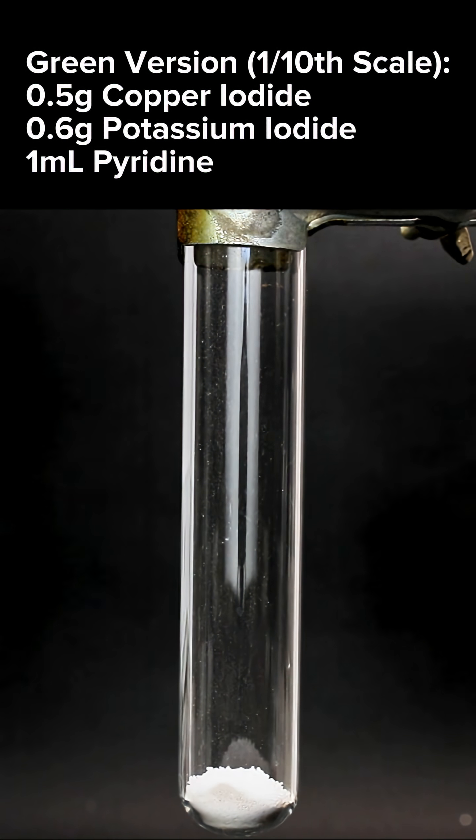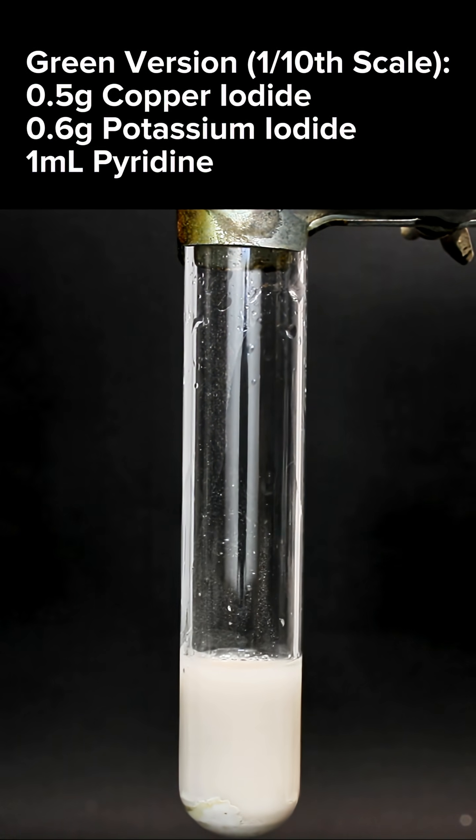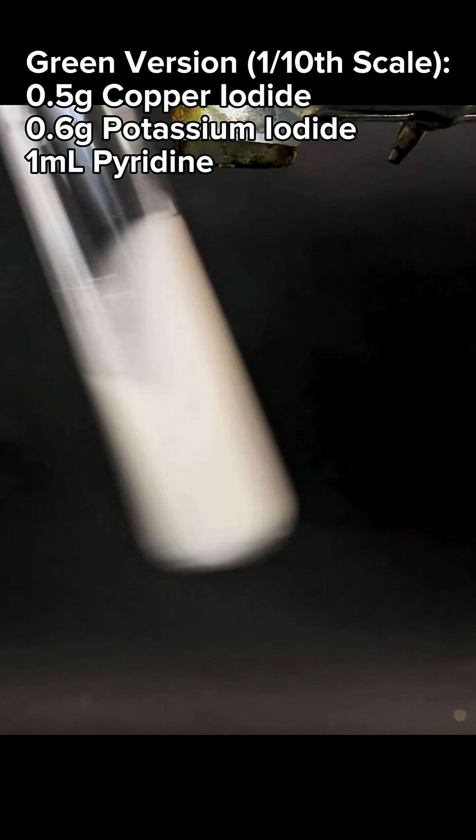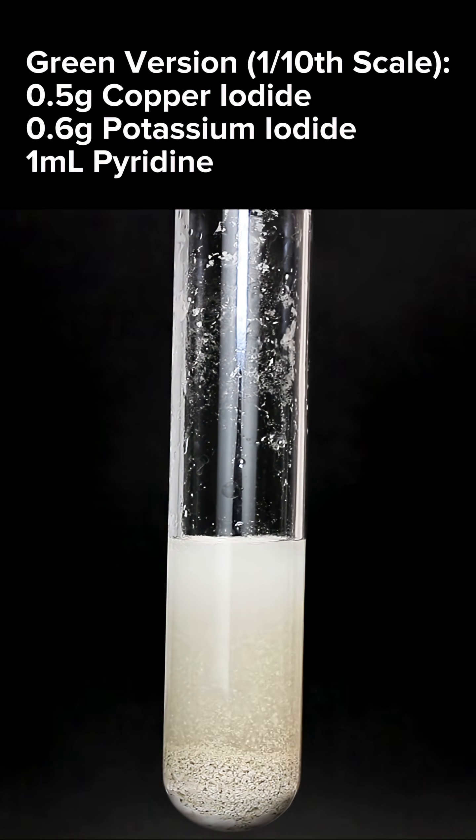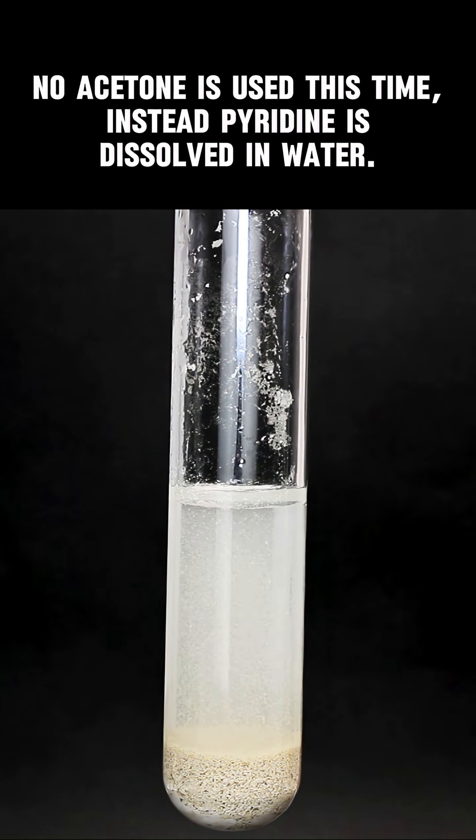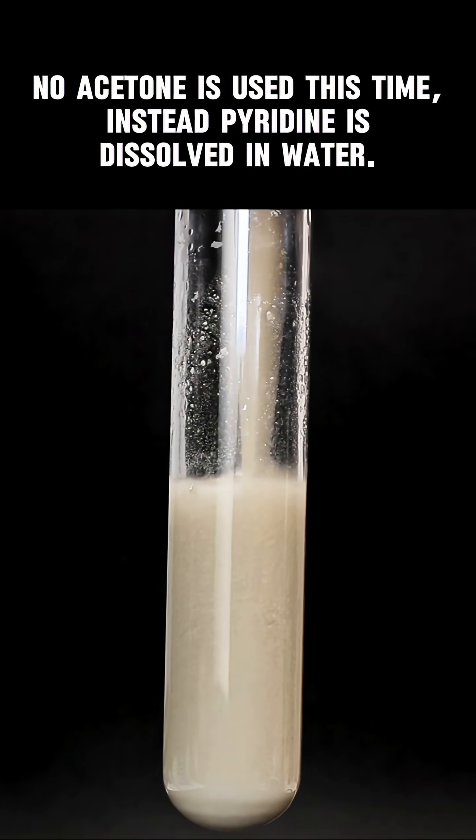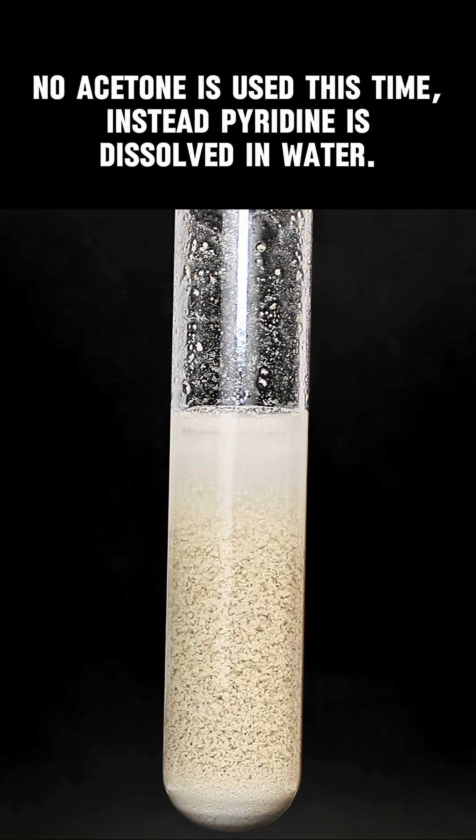However, you'll notice that this time pyridine is in massive excess and I didn't use any acetone. That's because for this complex, instead of copper and pyridine being bound in equimolar amounts, there's twice as many pyridine molecules as there are copper ions.